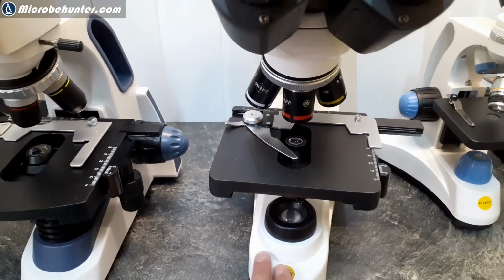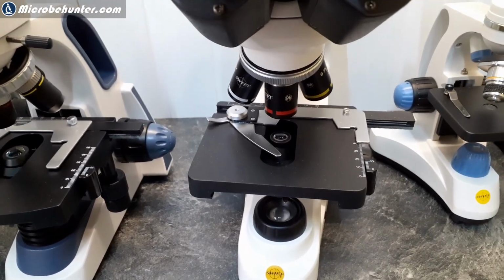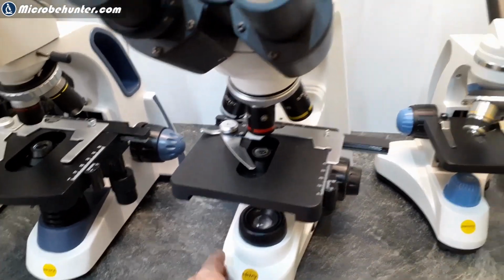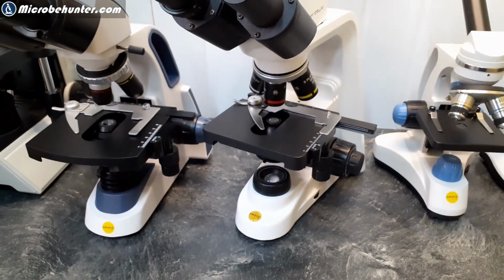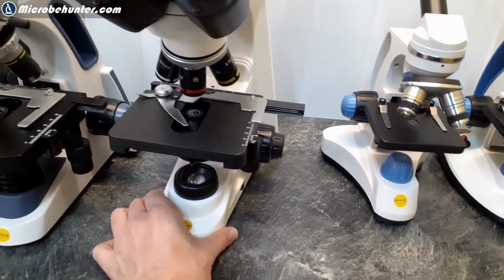It's a little bit like the law of diminishing returns. If you need a feature that cannot be found in one, then sometimes the price gap is quite considerable. By the way, I made separate review videos of those microscopes anyway, so I'm just going to give you an overview right now, and simply to illustrate to you that the difference in features is not so much. Here I call them the mid-range microscopes.